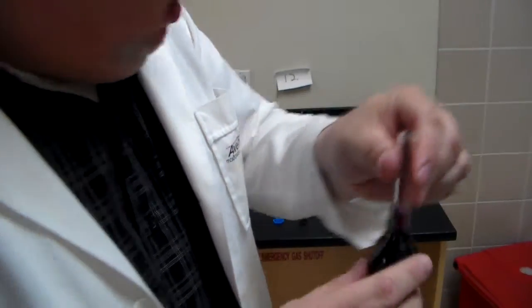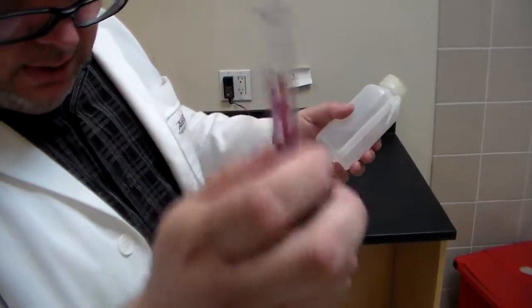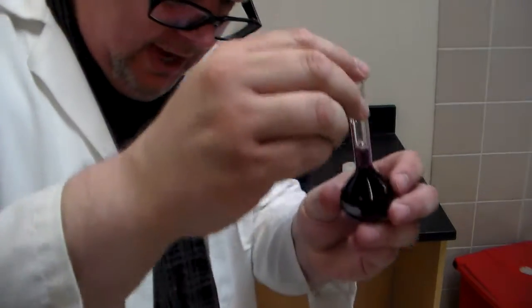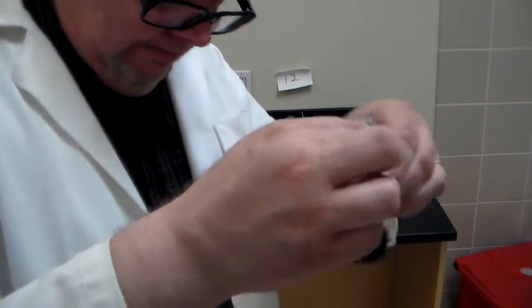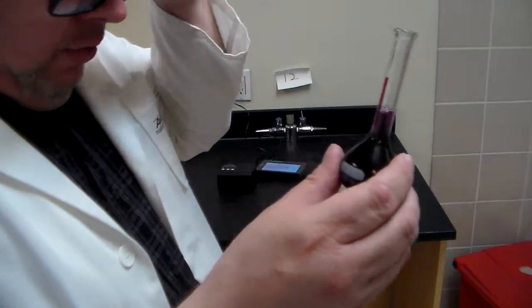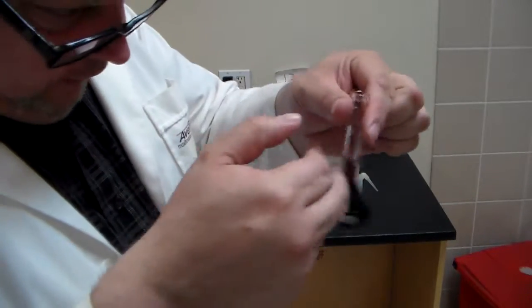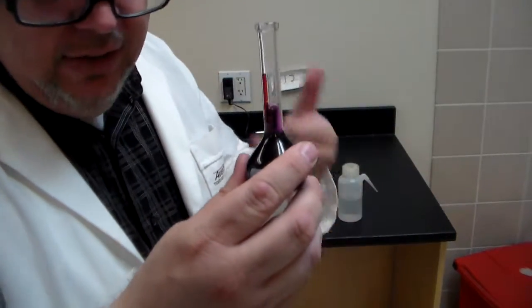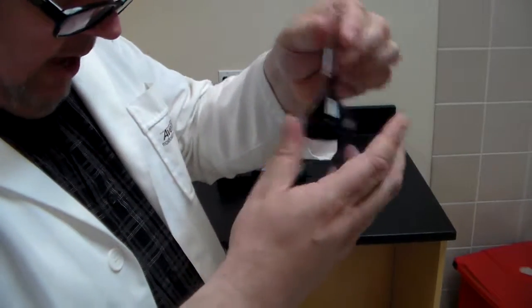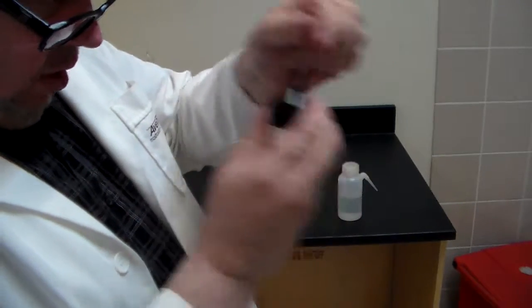Okay, so I'm going to try to tap out the air bubbles in there. They're all at the top, so that's not so bad. Now, believe it or not, the concentrations are already very dilute to begin with. We're talking about times 10 to the minus 6th molar for these. I cannot get my hands on the original powder to make the dye with, because then I could mess around with the molar concentration. So I have to take it as I get it from the store.